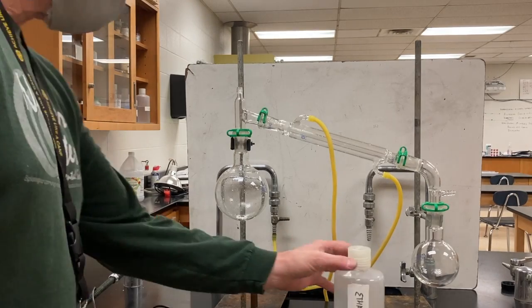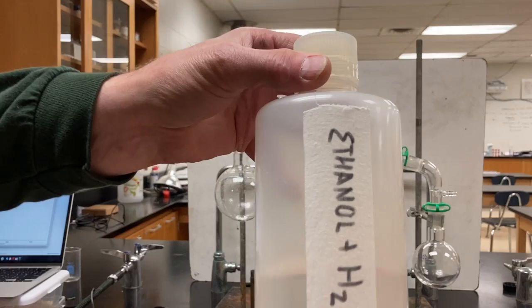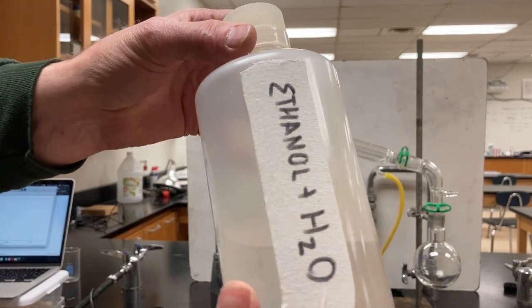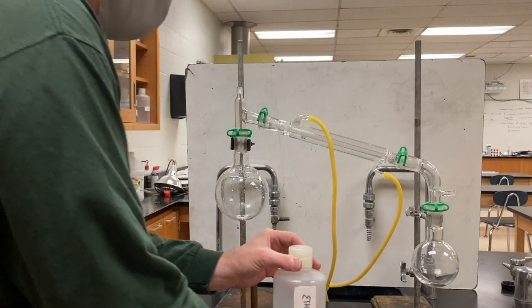In this video, I'm going to take a mixture. It's a homogeneous mixture. It's ethanol and water. Ethanol is a type of alcohol. It mixes thoroughly in water.